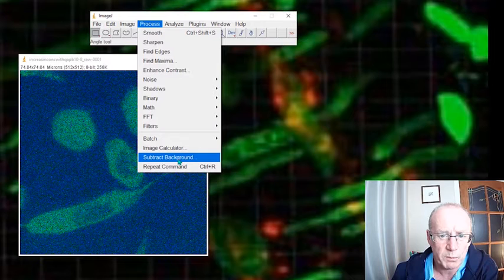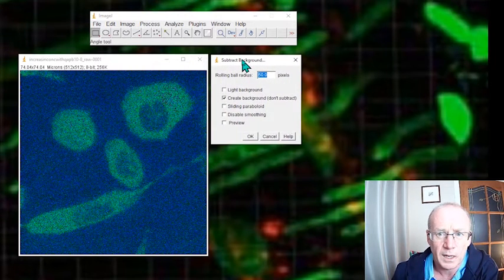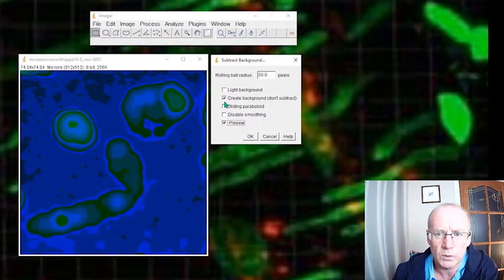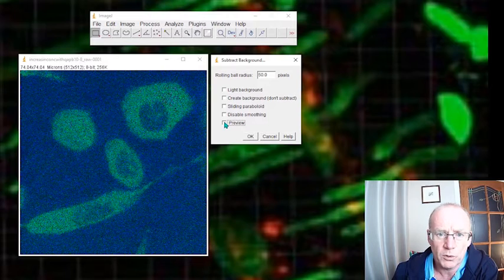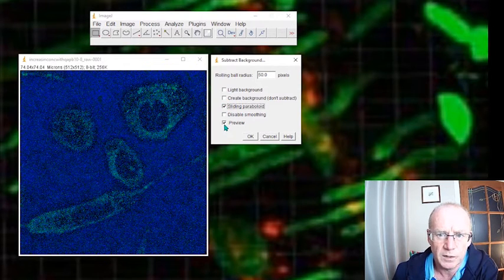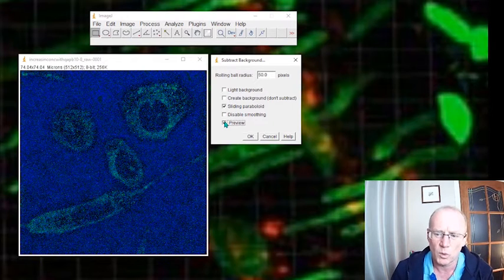Well, we could just use the Subtract Background option. It defaults to the rolling ball radius, which you could look up in the manual for ImageJ. If we preview it, you'll see it makes an estimate of what the background fluorescence is. Well, that's not too bad. The sliding paraboloid is the more modern version, and that might work quite well too. This, of course, will be dependent on your individual images, what will work best for you.